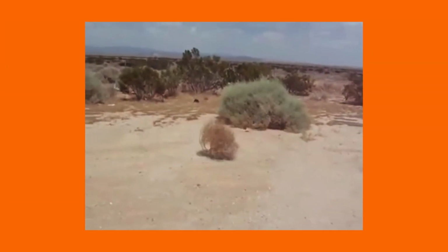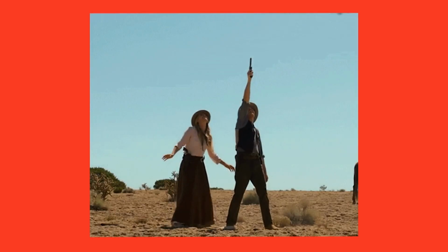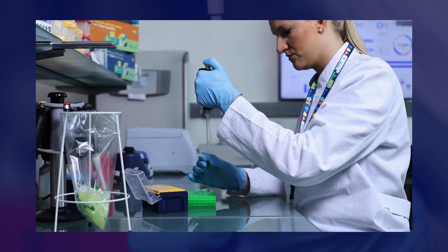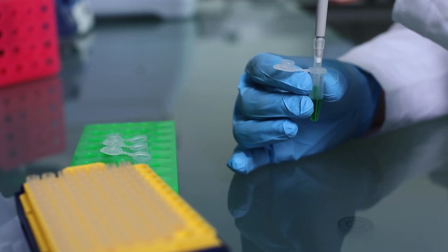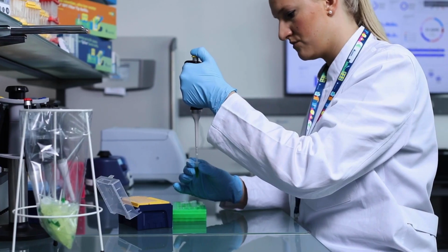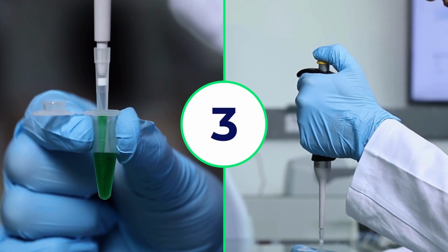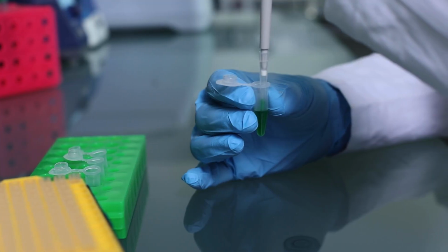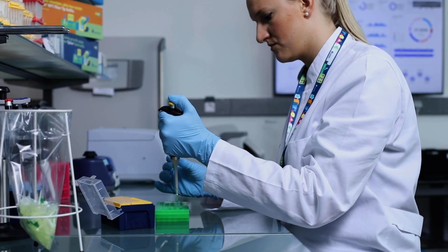Are your pipette tips dry as the desert before you start pipetting? Not good. Using a dry pipette tip to dispense your sample may be skewing the accuracy and precision of your results. Let's take a look at how the pros do it. Pre-wetting 3 to 5 times saturates the dead air inside the tip and tip cone to reduce evaporation of your sample. Slowly release the plunger, then press the plunger down to the first stop again, and aspirate once more. Repeat this a few times. Remember to pre-wet your tips to ensure accurate and repeatable results. Wet that tip before dispensing your sample.